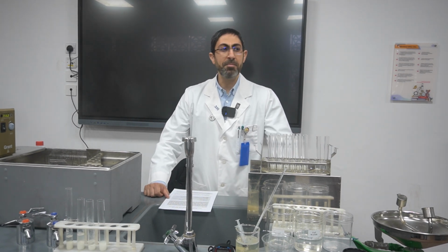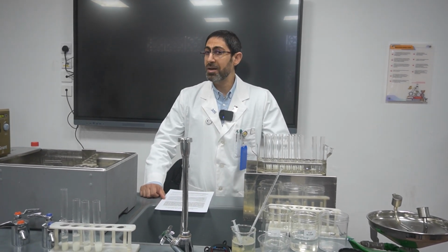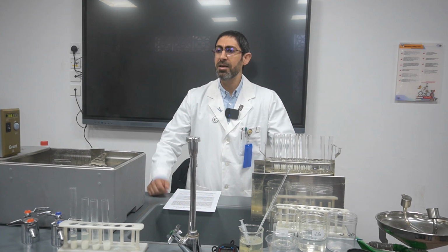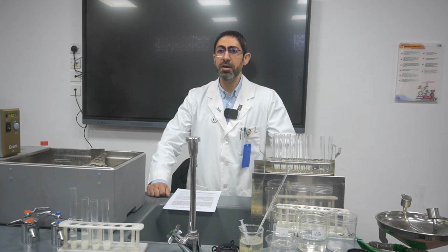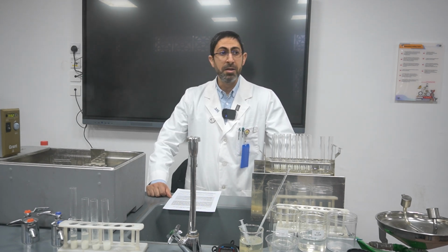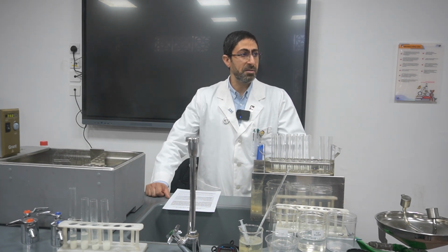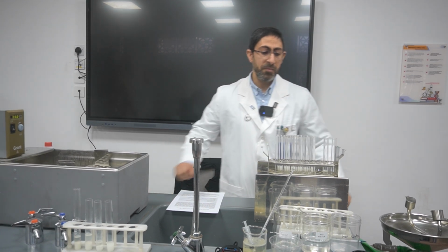Regularly, casein is broken down, or catabolized, by the enzyme trypsin into basic amino acids. This is a slightly slower procedure, which gives a prolonged, constant supply of amino acids to the body. Today our sample will contain powdered milk, which contains 3% casein, and the enzyme we will use is trypsin.